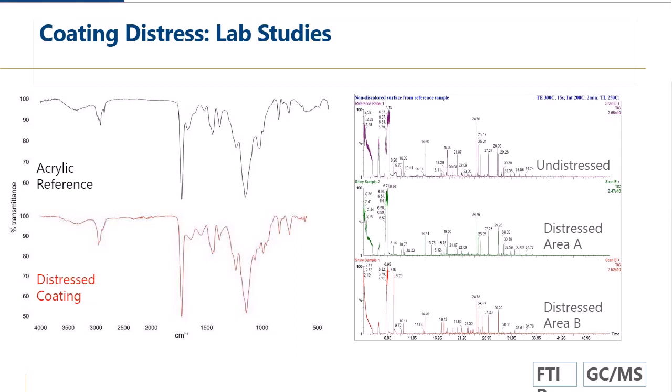With GCMS, it looks at the material in a little bit different way, so sometimes it's more helpful for looking at fine differences in material that can be associated with degradation. And here, each peak in the GCMS is related to one compound in the complicated mixture that is this coating. So the important thing is if you just look at the peaks on the chart between the undistressed at the top and the two distressed coatings, they're all basically the same. So we're not seeing chemical alteration of the coating.